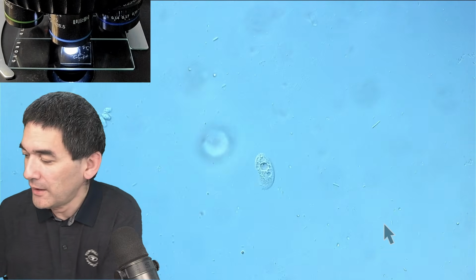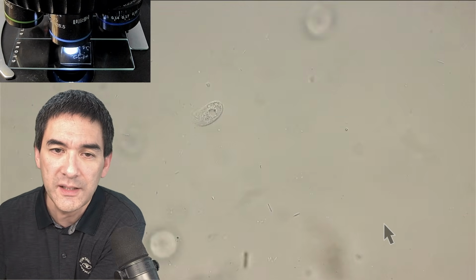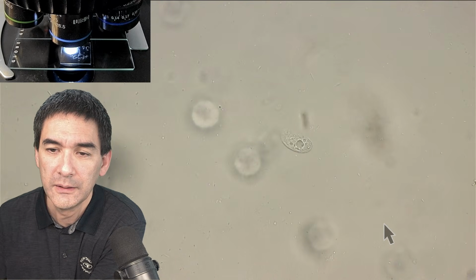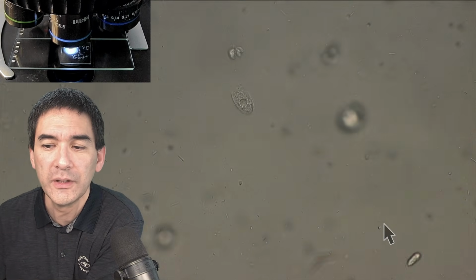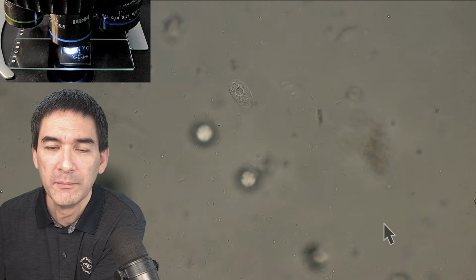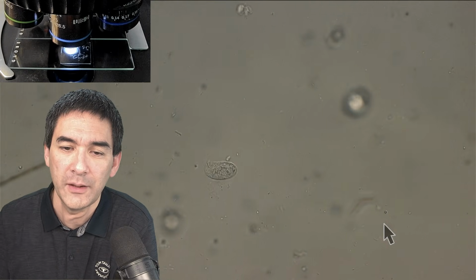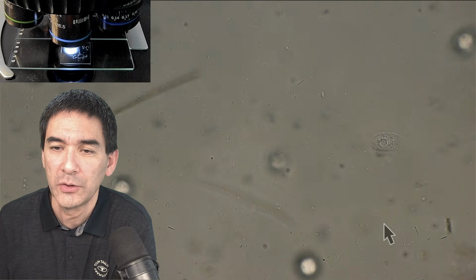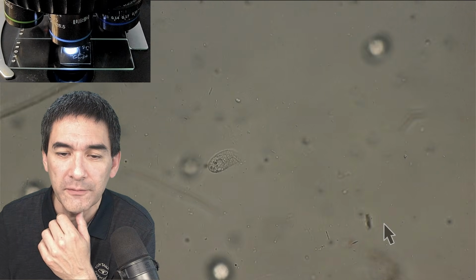Okay, let's try a bright field again. You see how much brighter it becomes. The DIC really takes up a lot of light. And here we go. You might also close the condenser to increase contrast. Ah, here's another one. This one is still moving fairly quickly. So the idea is you have to play around by adjusting the amount of methyl cellulose that you use, and you have to mix it properly. It could also be that here on the side it was not properly mixed, and that's why they're still moving a little bit faster.